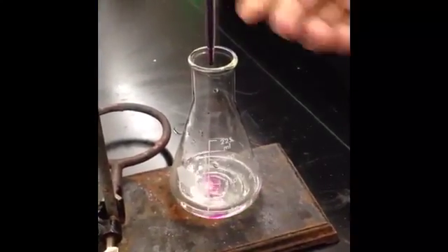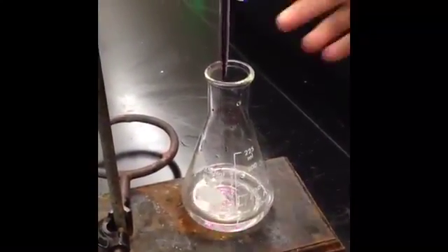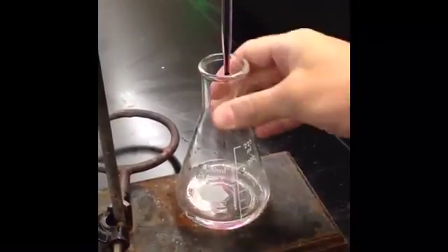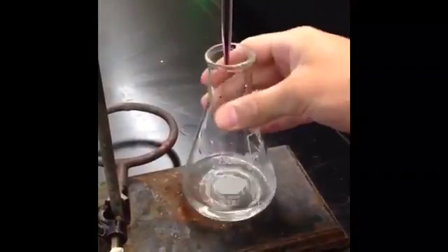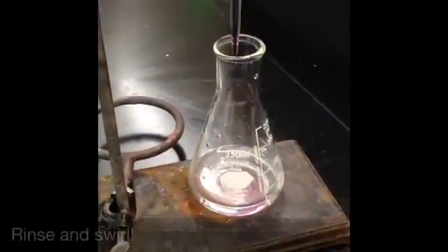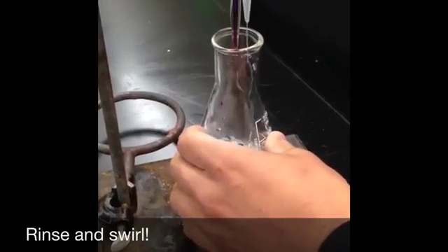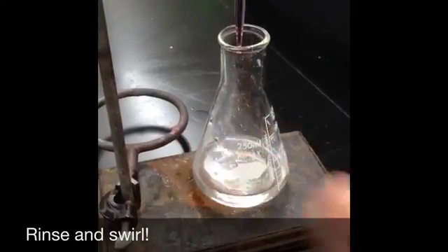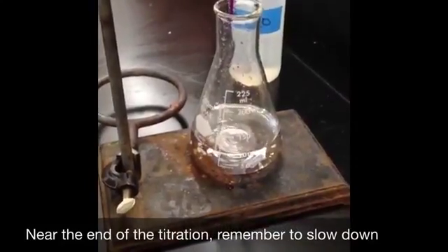In the beginning of the lab, we will add 1 milliliter of potassium permanganate to the solution of hydrogen peroxide. Remember that after each milliliter is added, you must swirl the solution so that the hydrogen peroxide can react with the potassium permanganate. When potassium permanganate is on the sides of the flask, you have to rinse and swirl to make sure that all the potassium permanganate reacts with the hydrogen peroxide. This will not change the concentration of the solution.